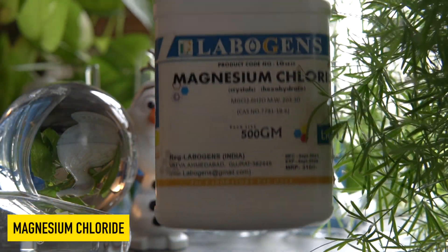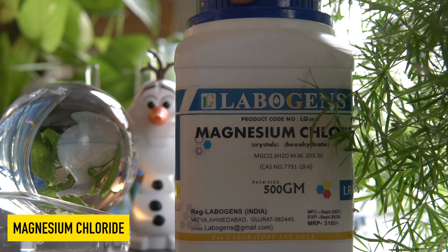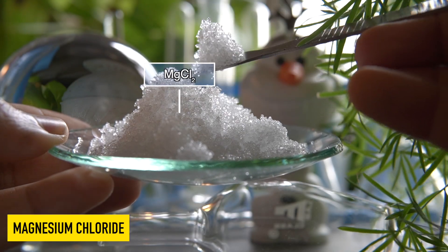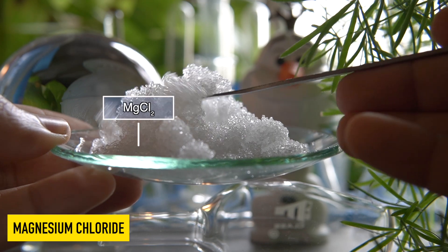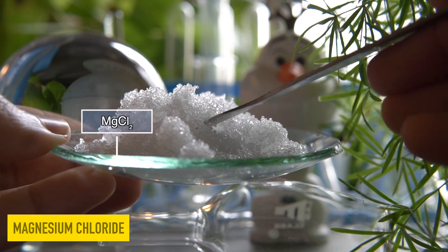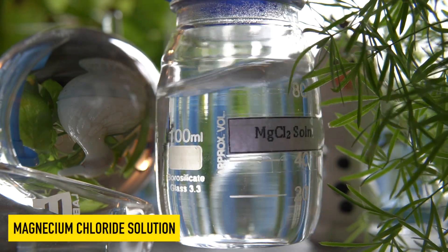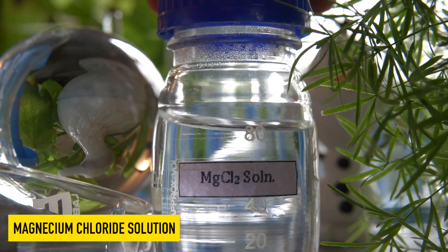This is magnesium chloride, a deliquescent white solid. It means that it has a tendency to absorb moisture from air and dissolve in it. It is very easily soluble in water to make its solution.